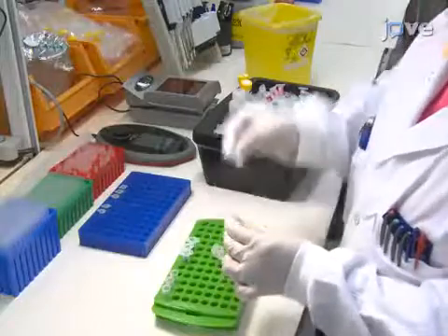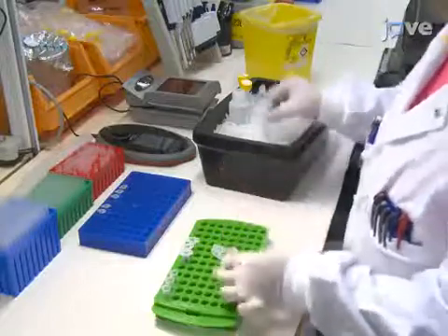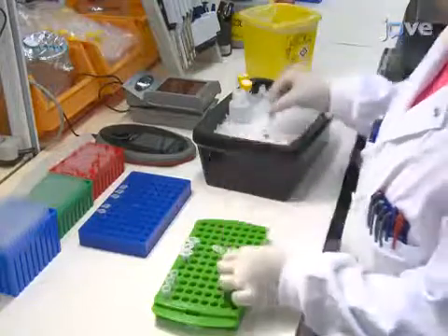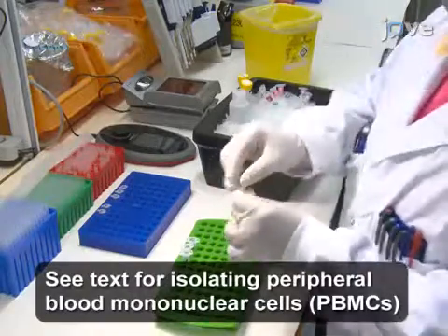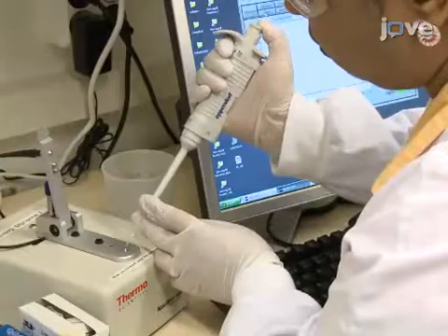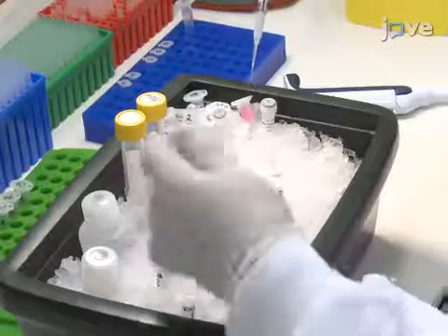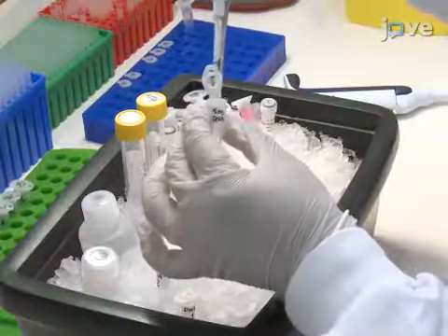To begin, use a commercially available DNA extraction kit to isolate genomic DNA from the patient and normal peripheral blood mononuclear cell samples according to the manufacturer's protocol. After quantifying the genomic DNA as described in the text protocol, dilute 5 micrograms of genomic DNA from each sample to a total of 200 microliters using TE buffer, giving a final concentration of 25 nanograms per microliter.